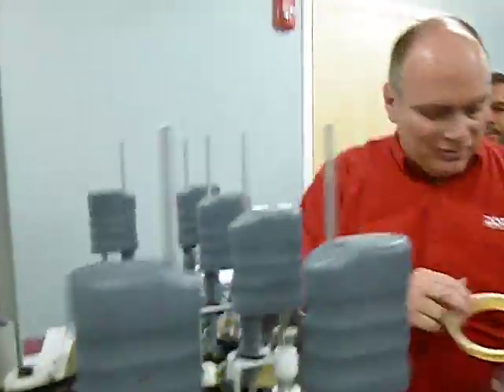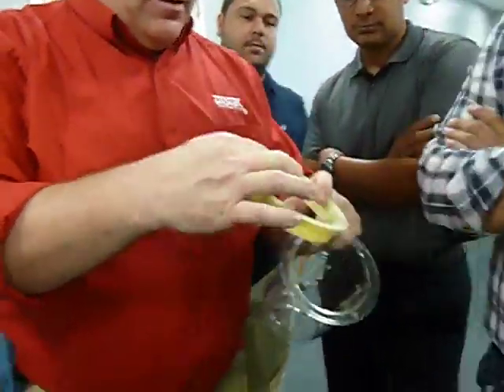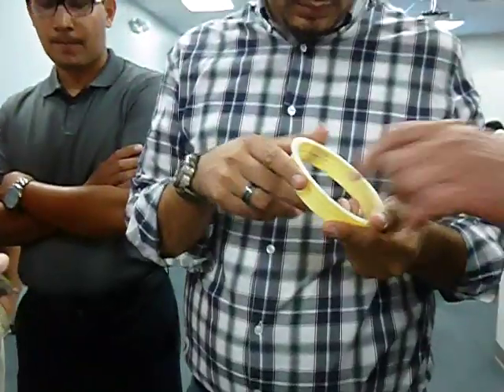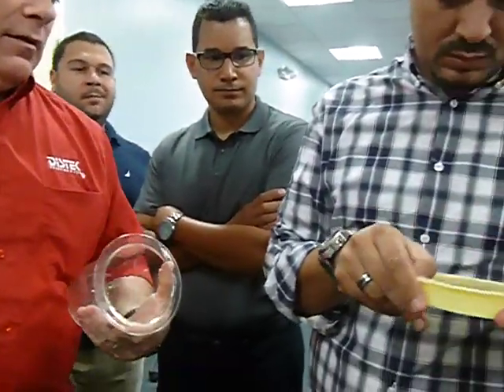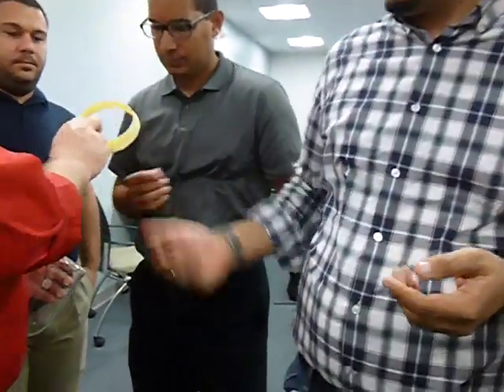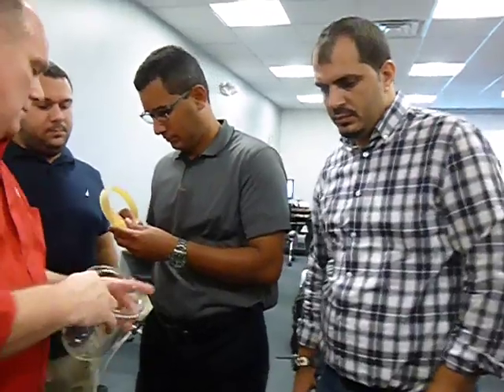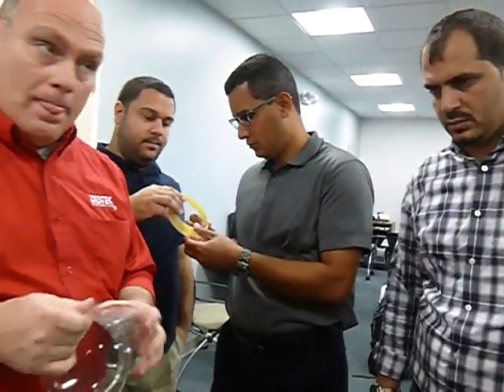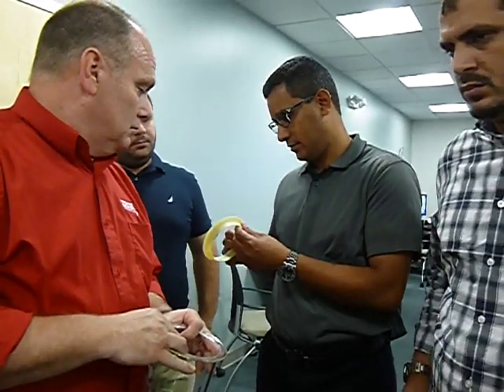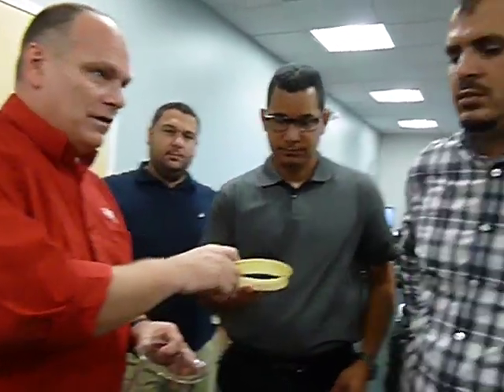The vessel centering has a small ridge on the inside here that each one of you wants to see and feel. That actually helps hold it onto the glass a little tighter. Just want to make sure the integrity of that is nice and fine. It's like a graded plastic, and it's got some pliability to it.